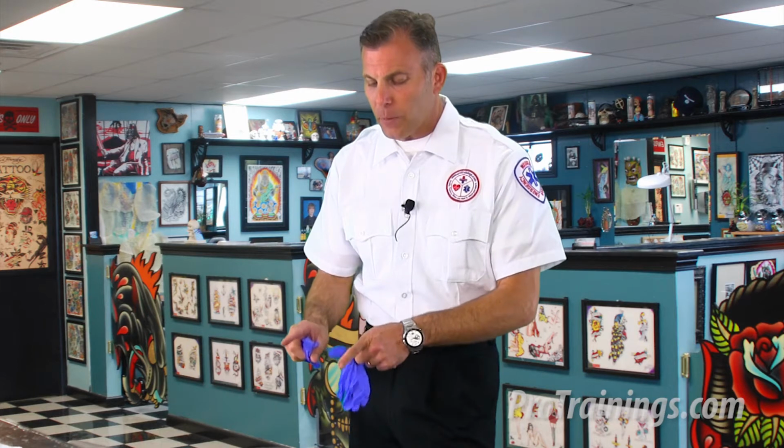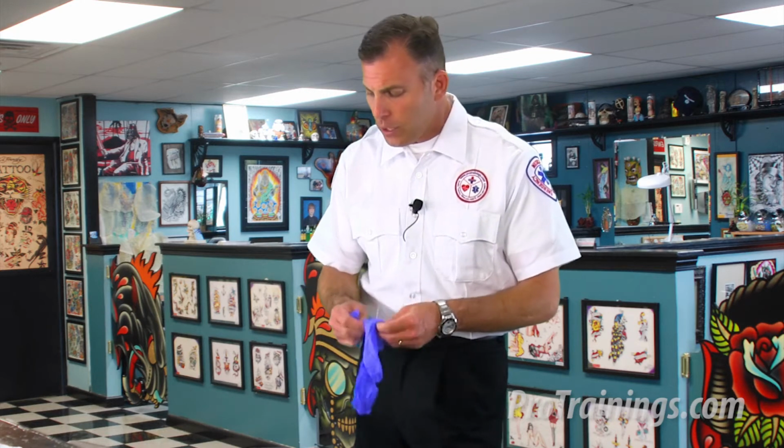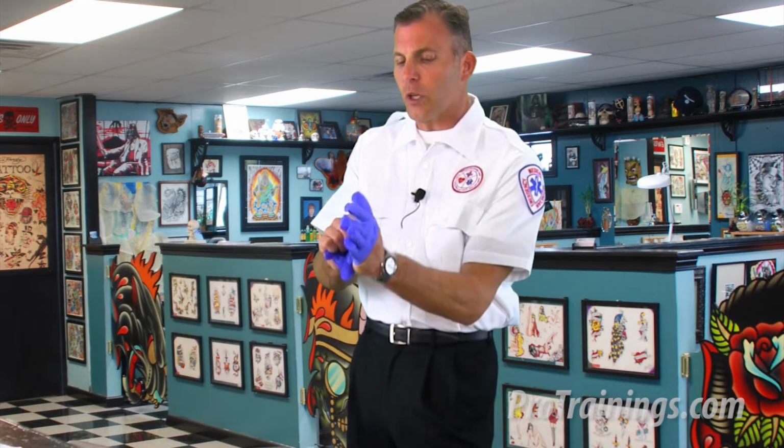If there were any sharp objects, remember we would remove those sharp objects, broken glass, sharps, needles, things like that, with tongs, put them into a contaminated sharps protecting basin of sorts so that we could disinfect that at a later time or dispose of it properly in a sharps container. We do not have any sharps, so I'm going to go ahead and put on my first pair of gloves.